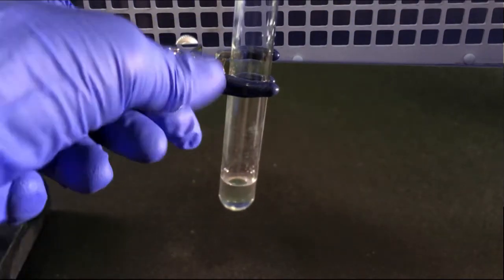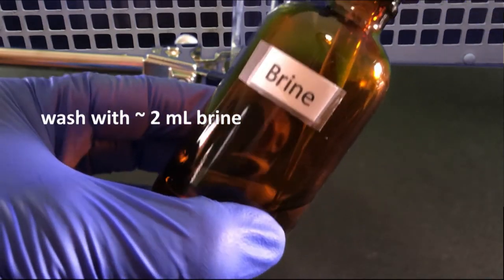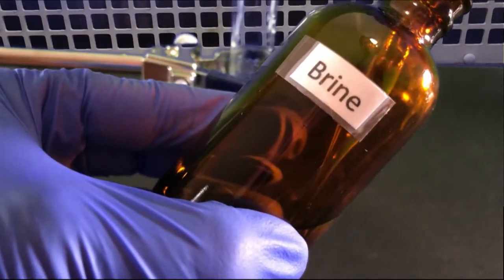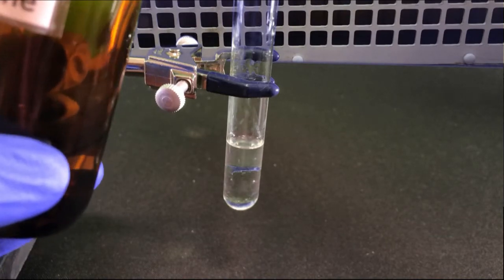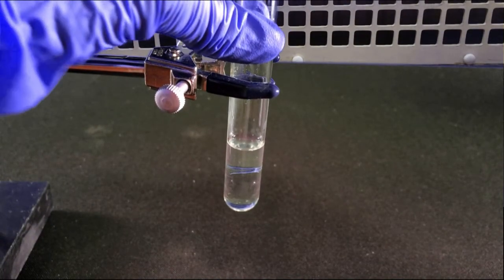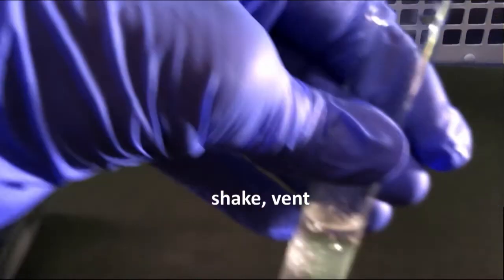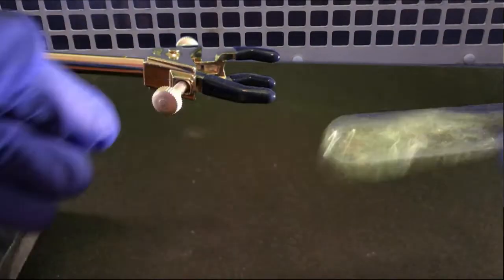This final wash will help to remove small amounts of water still in the ether. Water is slightly soluble in ether, not to a large extent, but there is likely some in the organic layer. Remember that the high ionic content of the brine will decrease the solubility of the water in the ether, which will remove it from the organic layer.